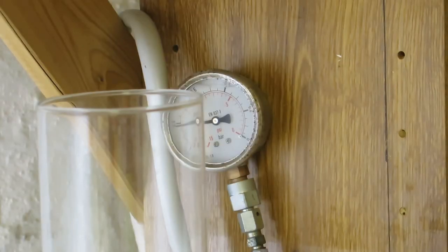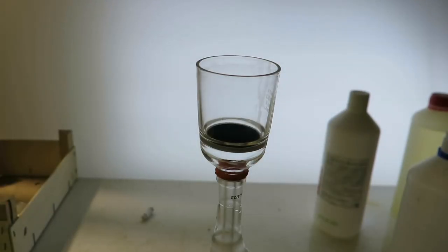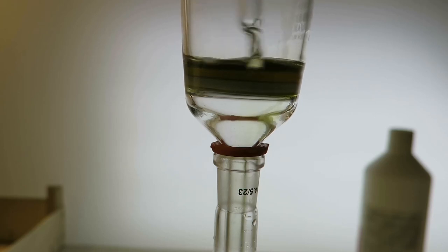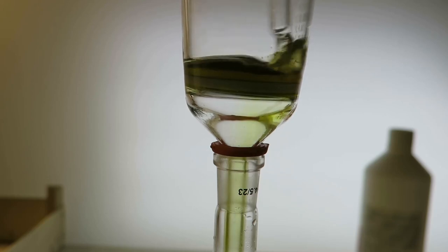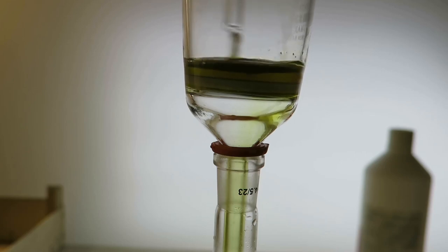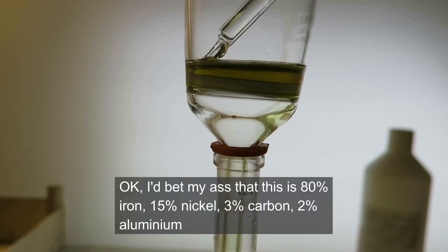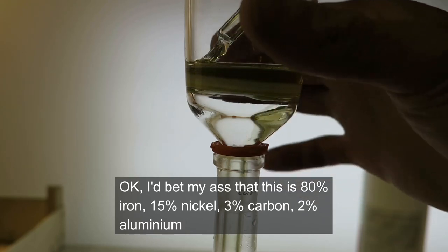Okay, this is now airtight. Okay, so let's add a little bit of hydrochloric acid and see what happens. Seems that the substance has dissolved completely, and it is yellow. Okay, let's pull it down.